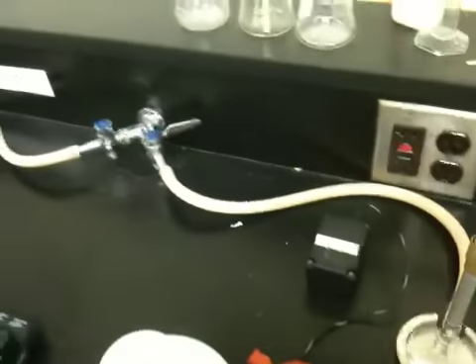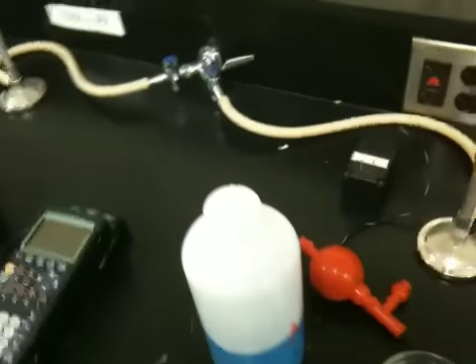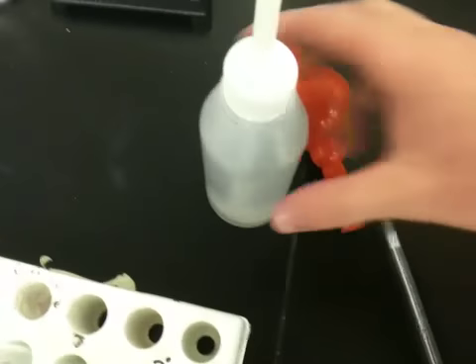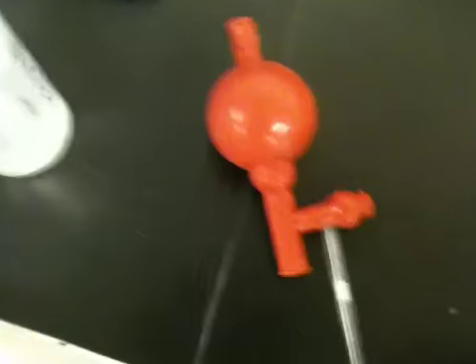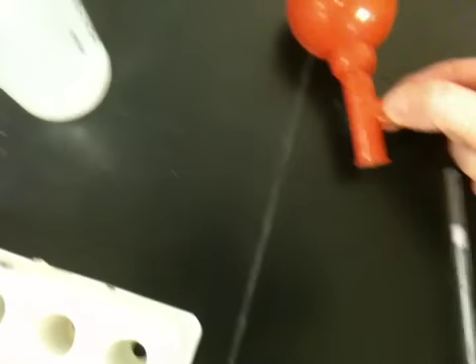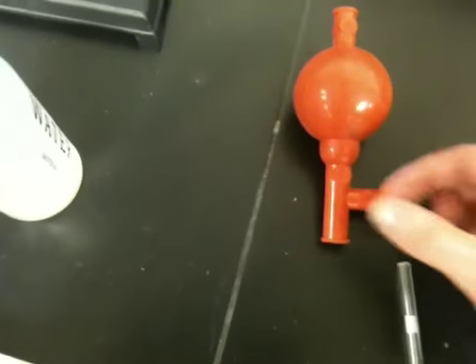So you're going to have to learn how to draw it up. No, you don't put your mouth on it and draw it up with your mouth. What you're going to do is use this bulb, which is kind of fancy. It has a bunch of valves that you're going to use to draw up your liquid. And I want to show you how to operate the valves. So we have here our bulb, and the valves are these little things that have letters on them, S, E, and this top one, I don't think I can see a letter. I think it says A there. When you pinch it, it opens the valve. When you let go of it, the valve is closed.